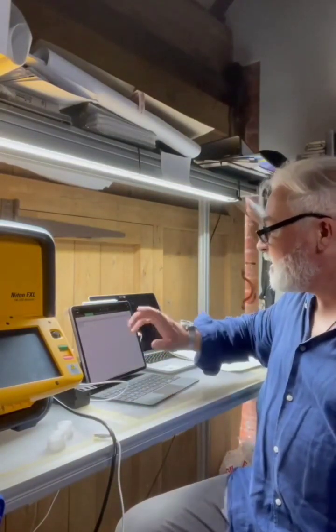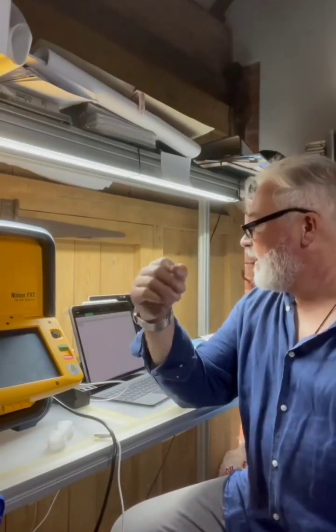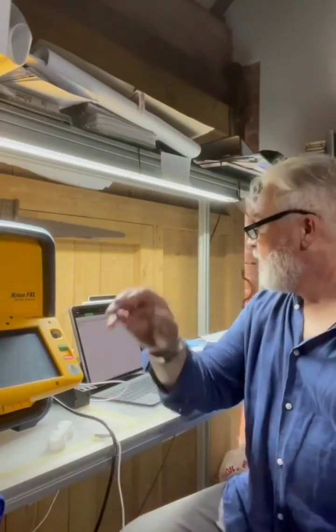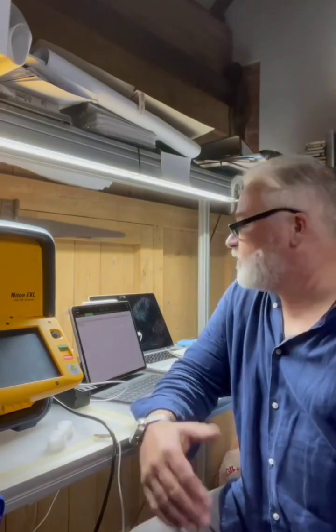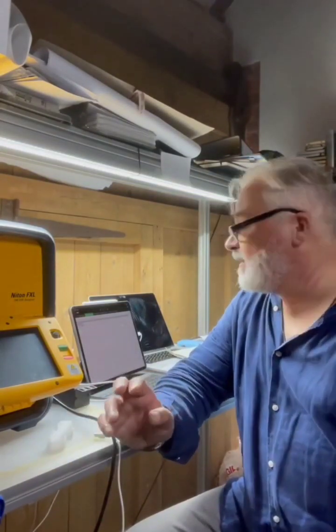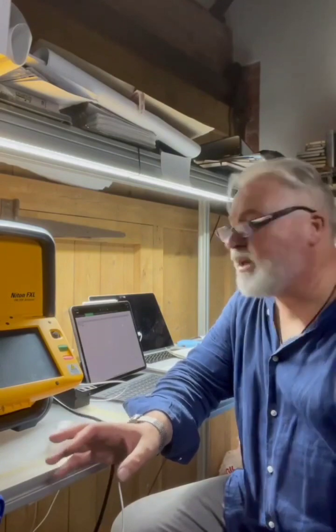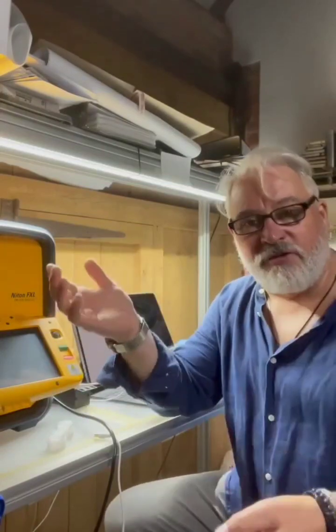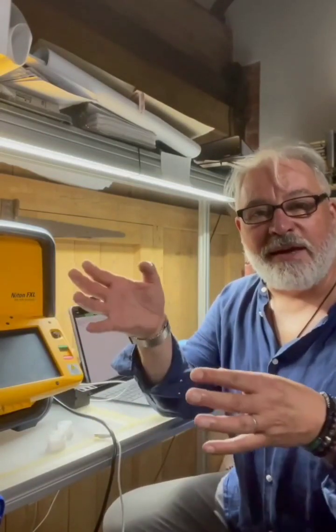And then we start to go into some interesting things. So we've got things like molybdenum. Now, again, molybdenum, 0.79 ppm, so not really a comparison when you look at the very high ppms that we've been talking about. Yet when we analysed what fell in the UK, we got 14.66 ppm. And then we've got nickel. So nickel, 68 ppm in atmospheric dust and 217 in the sample from the fallout here in the UK. Lead, 30 ppm normally in atmospheric dust, yet what fell in the UK was 114. Now a lot of that can be put down to local pollution. I live very close to the M6, so that could have been part of the fallout. So I'm not suggesting that they're dropping lead on us. I'm just saying that the lead may be as a result of me being close to cities and also a major highway here in the UK.